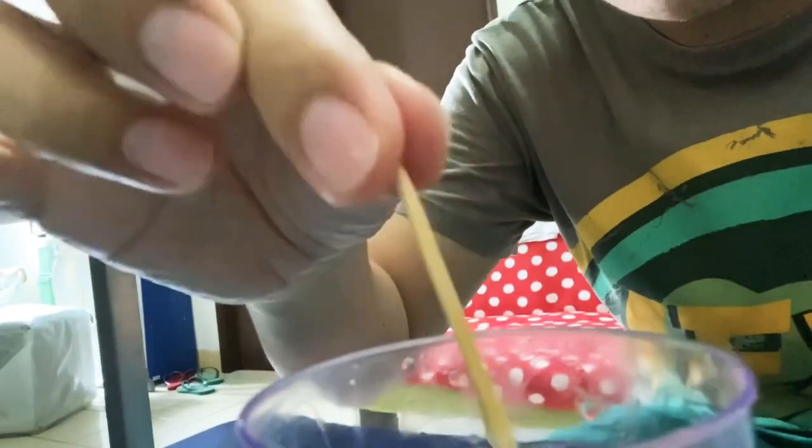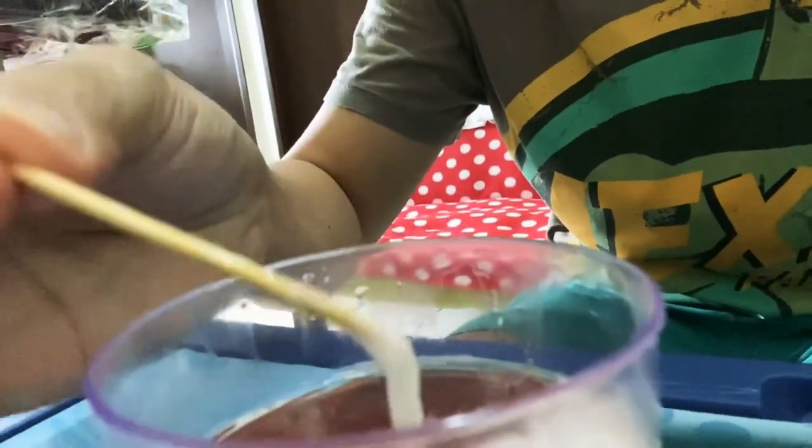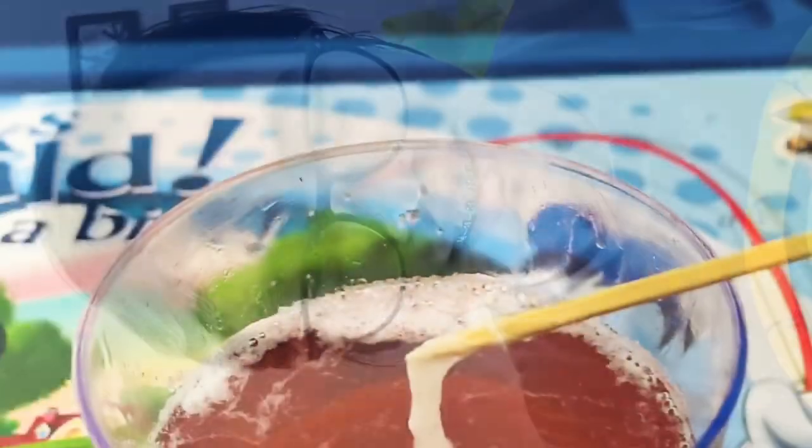I think that would be all for my recording. Students, this is a successful work-from-home experiment activity. I hope you can see and check that this is very possible — even while working at home, learning will take place. Once again, look at the DNA — like in the YouTube videos we were watching previously — that is how the DNA structure actually looks. Thank you.